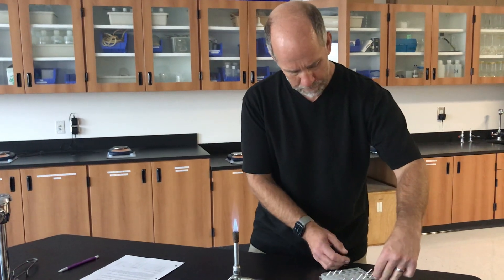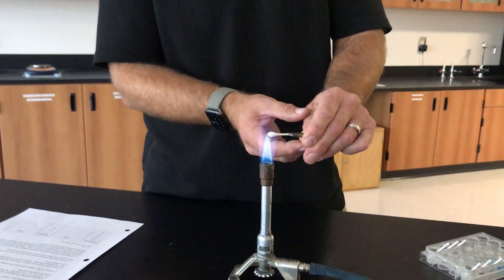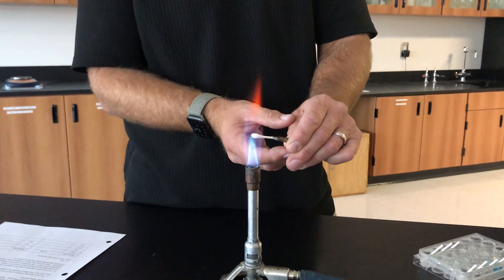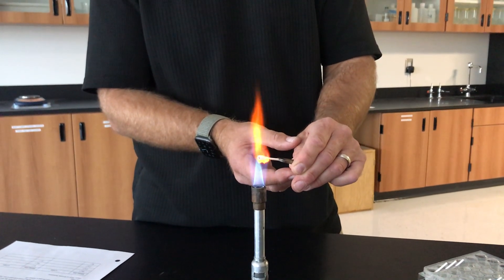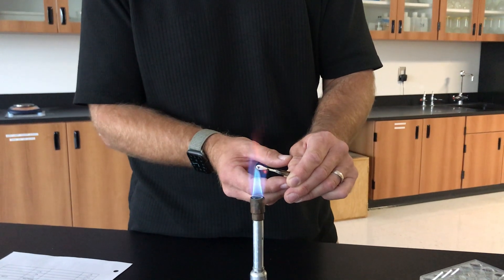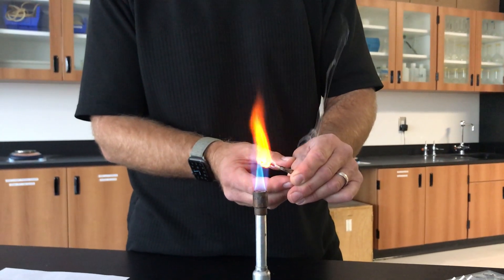We're now going to move on to calcium. We will soak that Q-tip, and here then is the calcium flame test. We'll re-dip and come back, and the color that you see there is the flame test color for calcium.